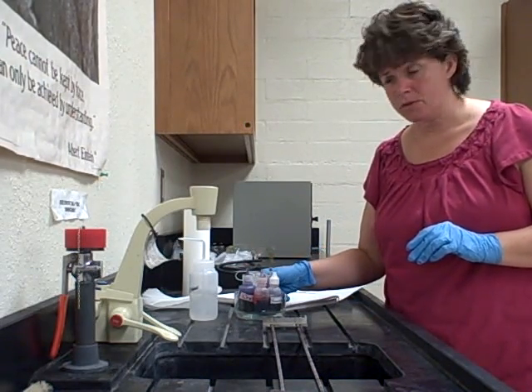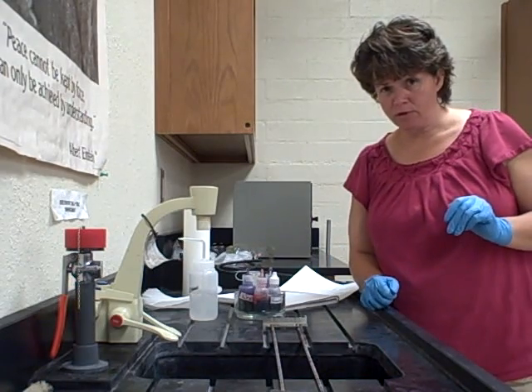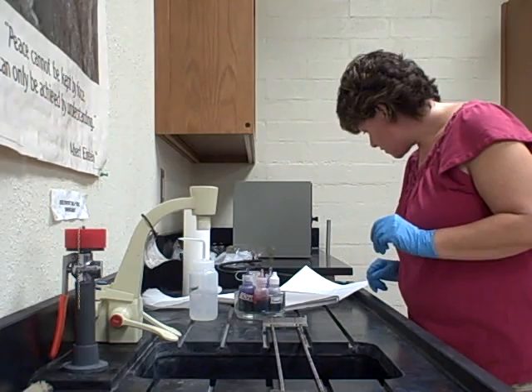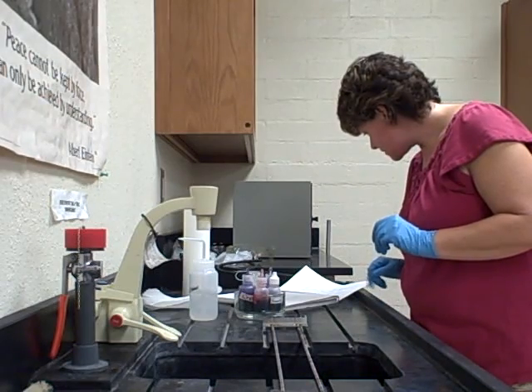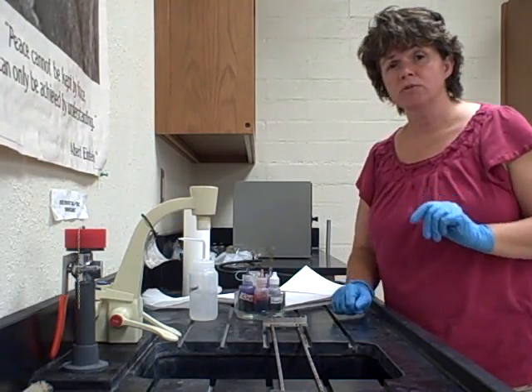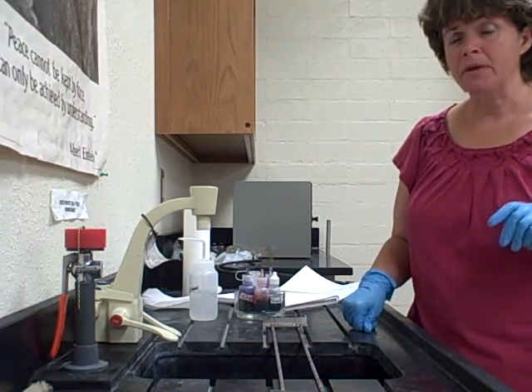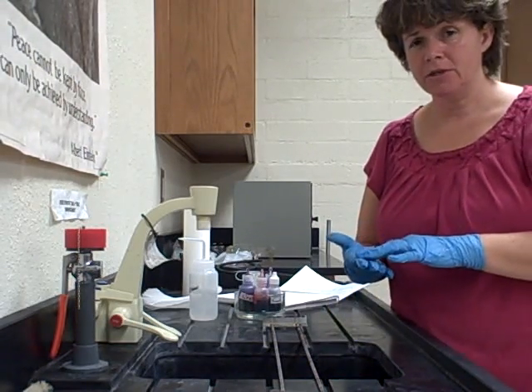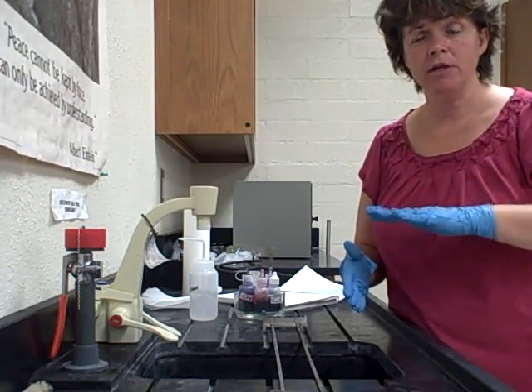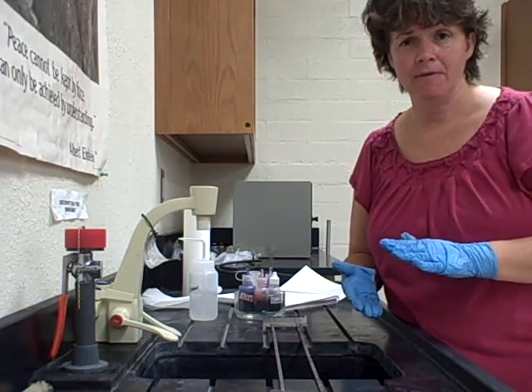On page 35 of your lab manual, the procedure says number one: prepare and fix a smear. You go through the same procedure as last time — put the bacteria on the slide, let it dry, and after it's dry run it through the flame a couple of times. That's the fixing.